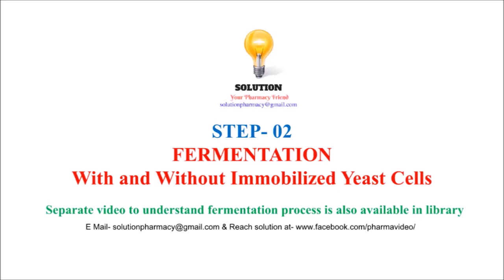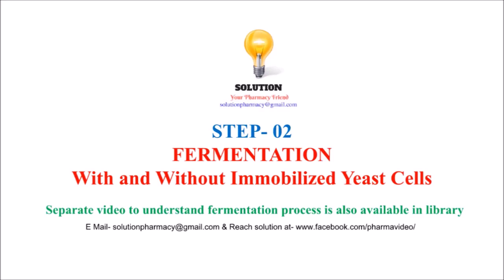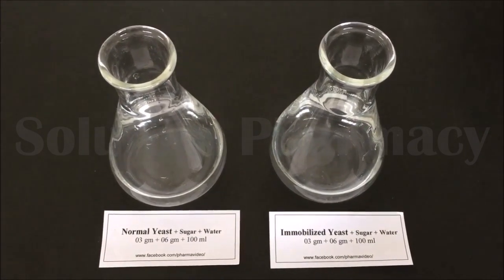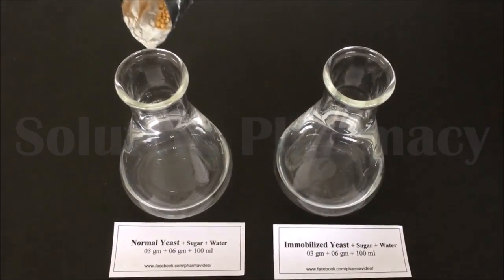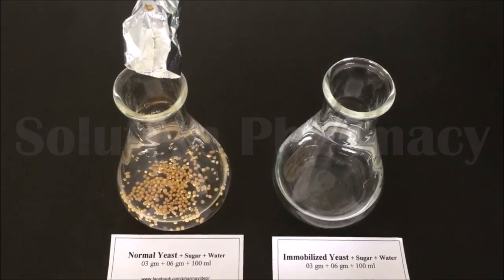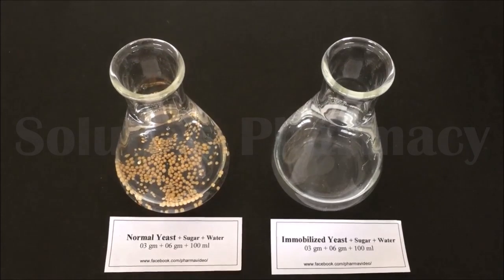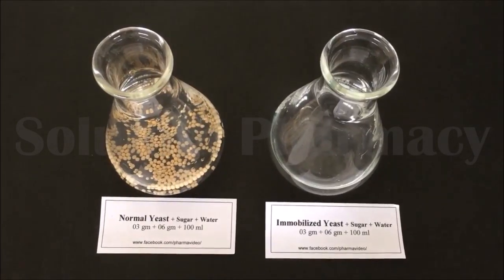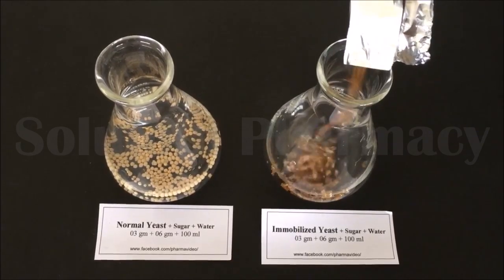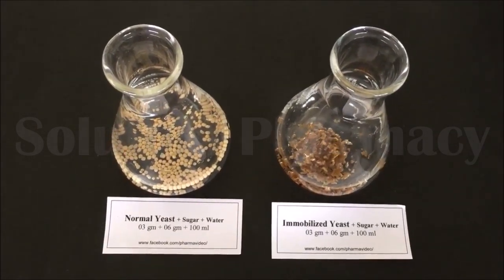For this we have taken two conical flasks, and in both we have transferred 100 ml distilled water to each conical flask. In the left side conical flask we have added 3 grams of normal yeast cell which is in granular form — this yeast cell is not immobilized.